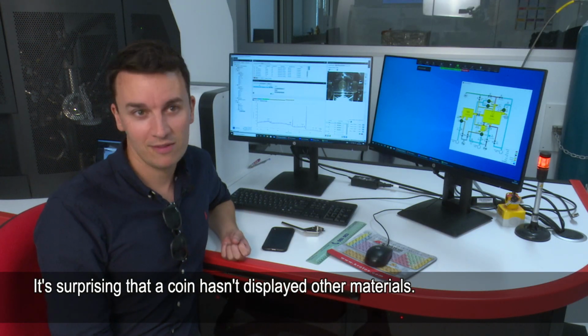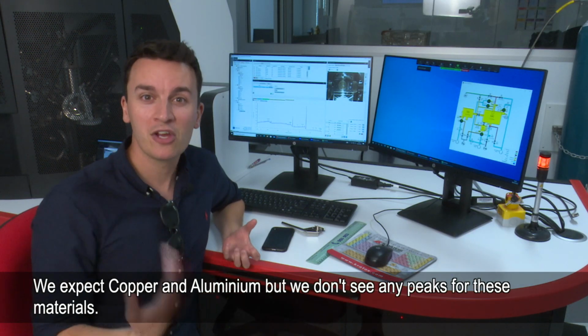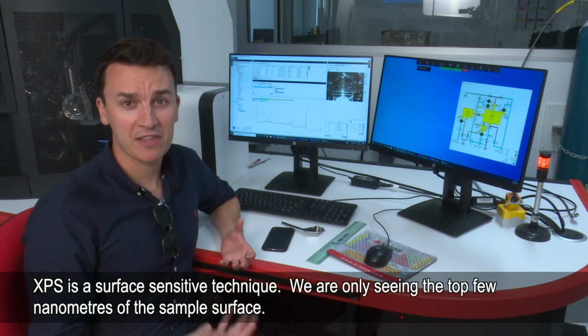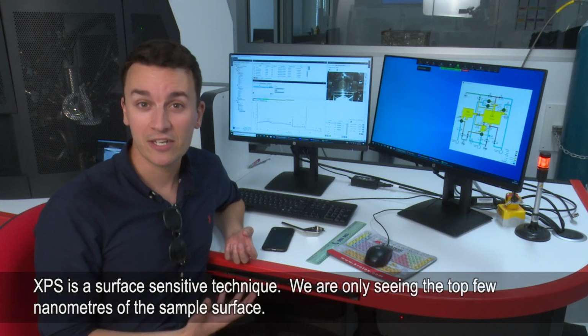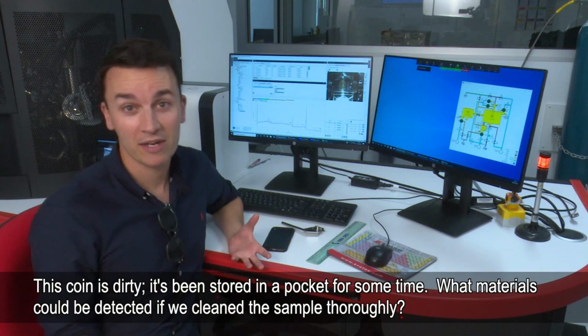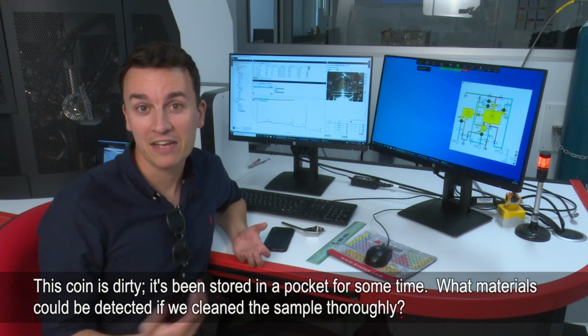It's a gold coin. Well, it's not actually made of gold, but it's gold in colour. We should expect this to be made of copper, aluminium, but we don't see any of that. And that's just because XPS is a surface sensitive technique. So we're only seeing the top few nanometers, and this coin is very dirty. It's been in my pocket for a long time. Nobody takes cash anymore. What am I going to do with it? It's just been sat there. So I'm going to clean it up and we'll see if we can get any of the elements showing.